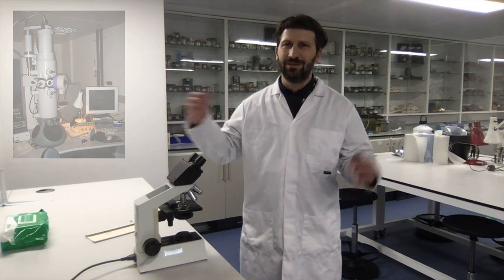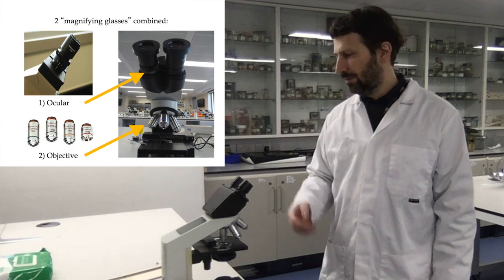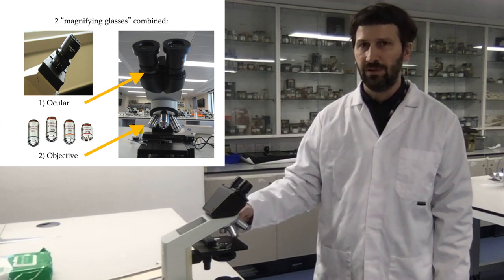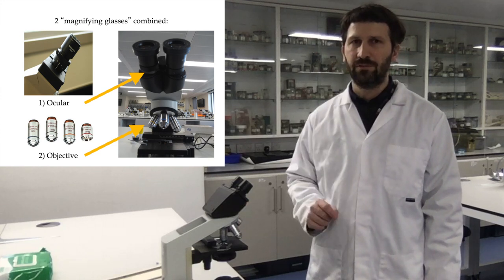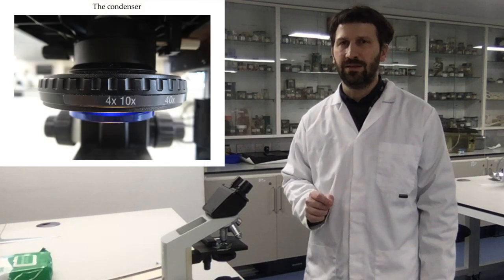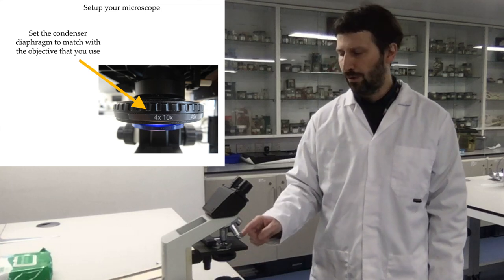A microscope is, first of all, just a series of lenses. You have two ocular lenses here, and then you have the objectives here that you can choose which one you use — these are the lenses closer to the object, to your specimen. And then there is another lens, which is this one here, called the condenser, which is important because it serves the purpose of focusing the light that comes from below onto your specimen.